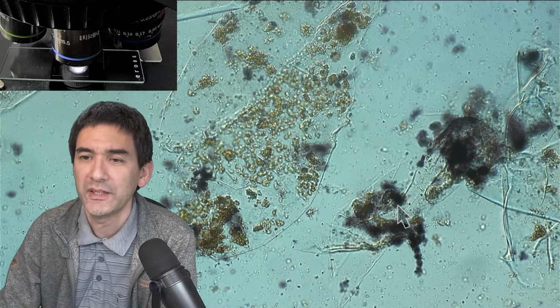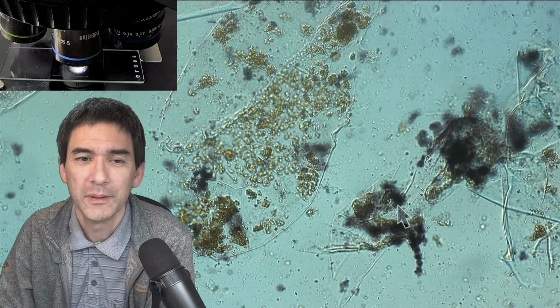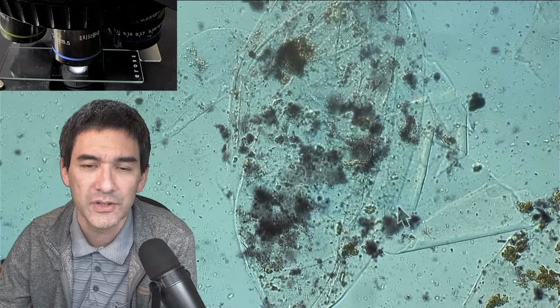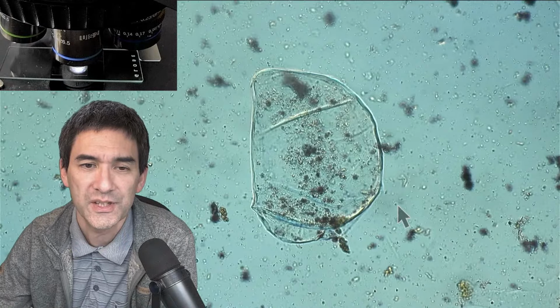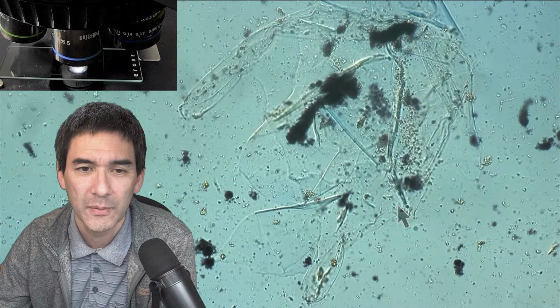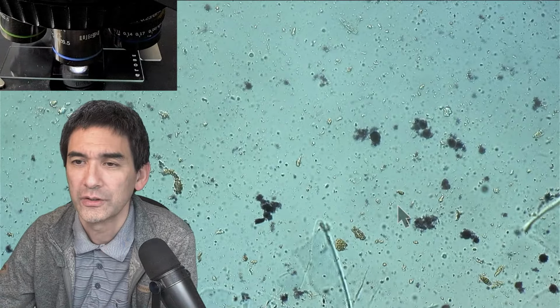Can you add iodine to see the starch in the banana? Yes, that's what I'm doing right now. It's good. But again, this is not quite as nice looking as some fresh banana, because there you can really see nice starch grains. It kind of shows that due to the processing, everything was pretty much homogenized. But at least all of those dark patches that you see, that's most likely starch.